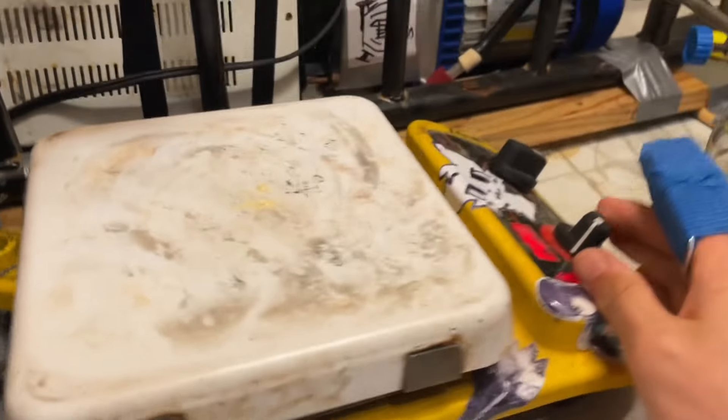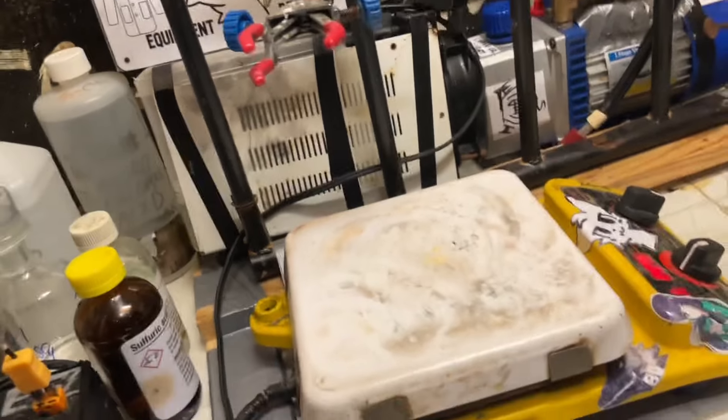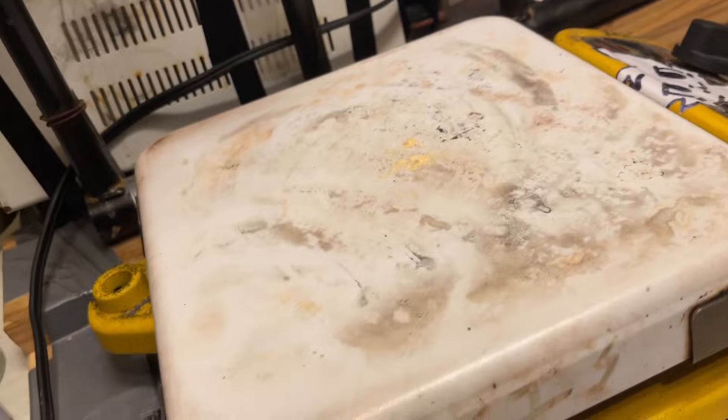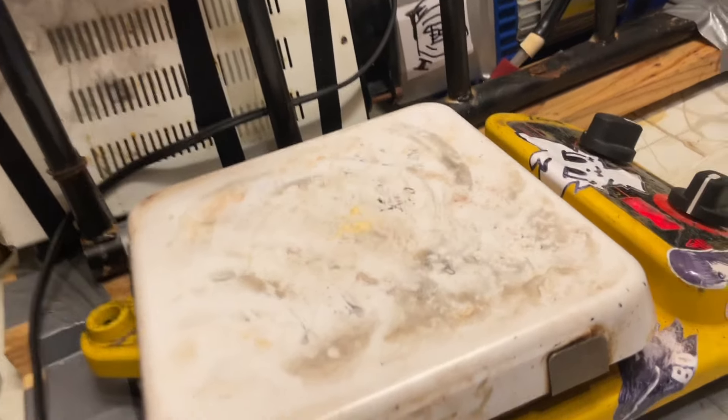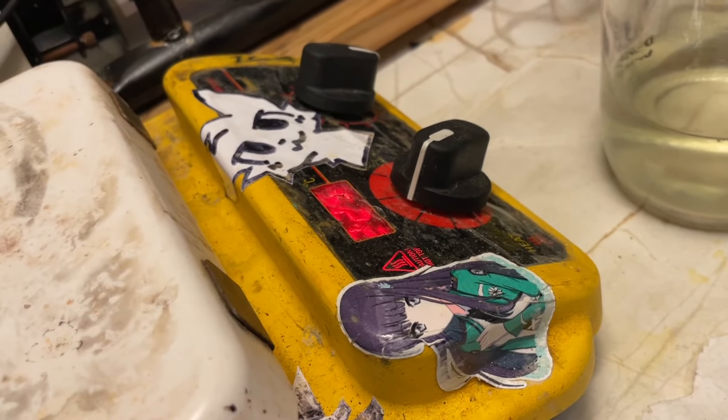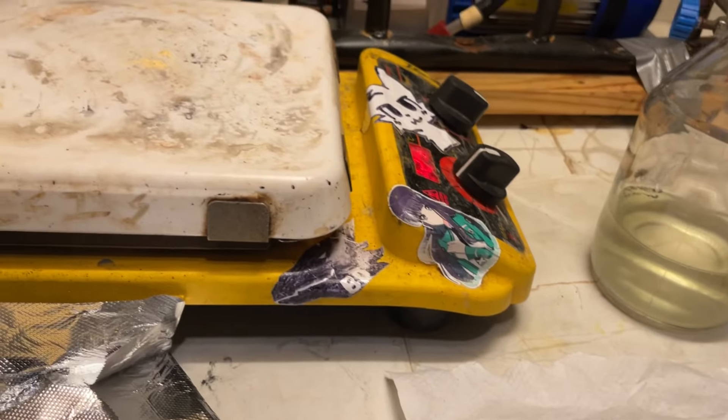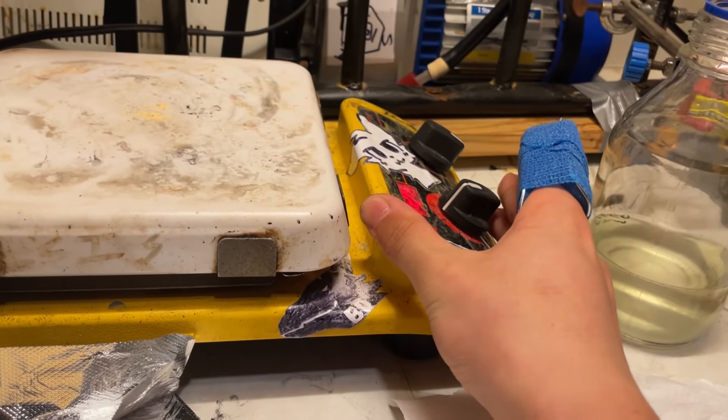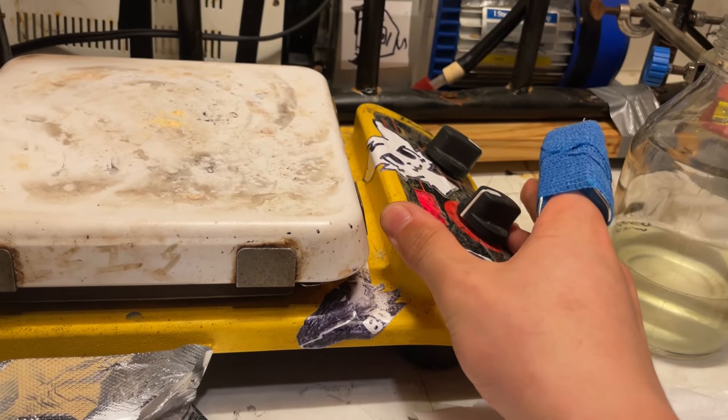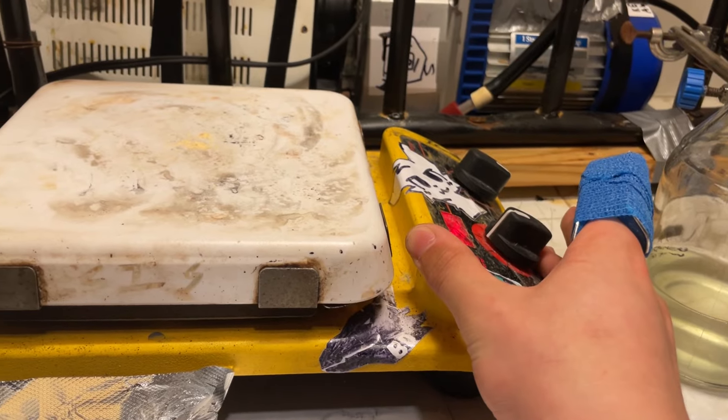You can see there's nothing. Let's go ahead and increment the temperature up to 220. Of course, the hot plate temperature is going to be lower on the surface than inside. Which is where the thermocouple measures internal temperature. But I also reduced the fume hood airflow. Actually, I'll just turn it off entirely. Because this doesn't decompose to anything poisonous. Oh, it's already at 225. We'll see if it decomposes.